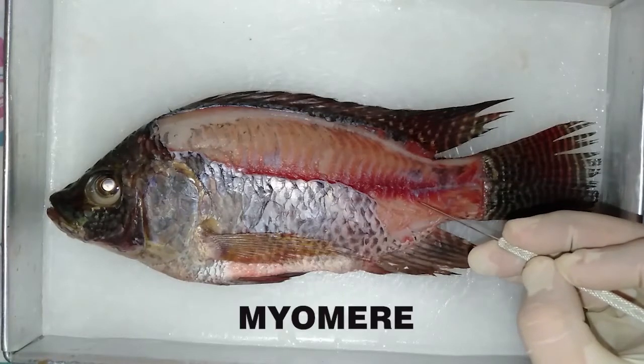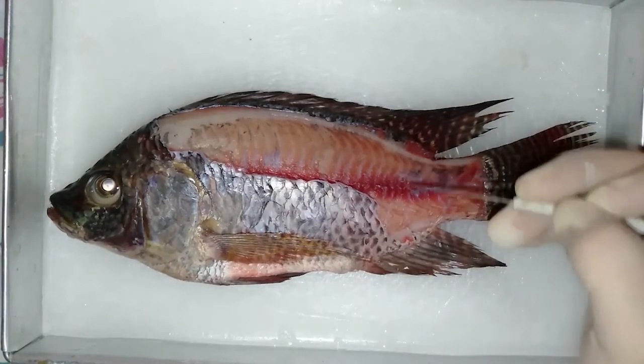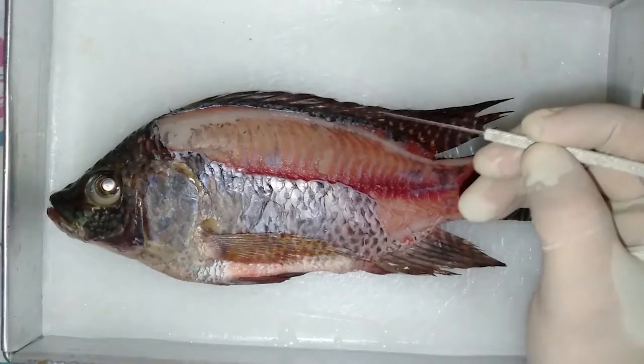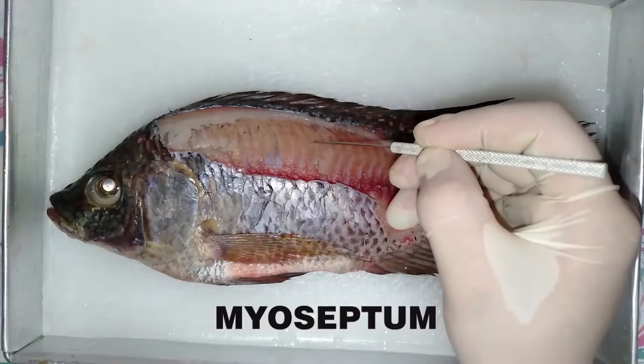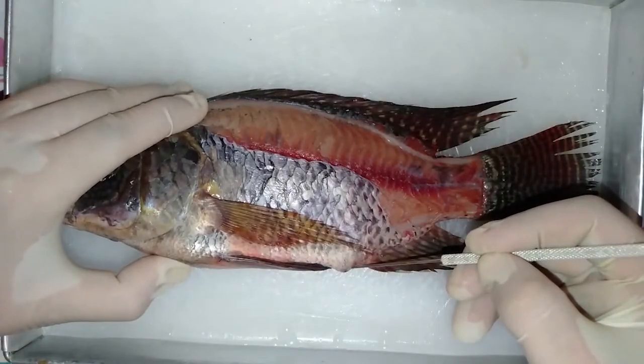This is the myomere, epaxial, hypaxial, horizontal septum, myoseptum, and this is the cloaca.